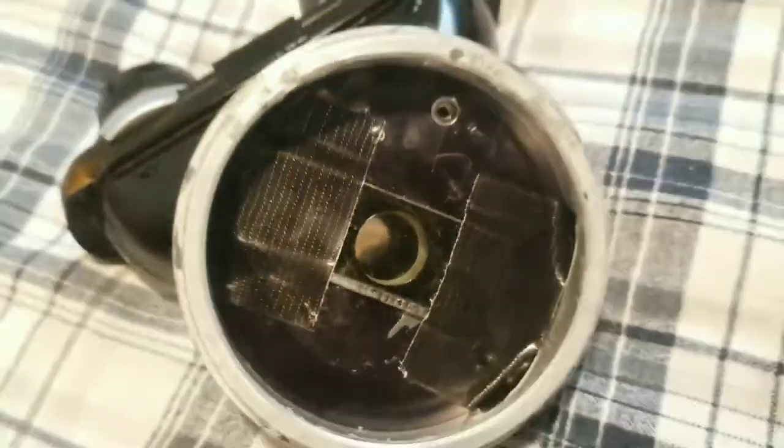As you can see, some tape. I didn't glue it because I want it to be reversible in case this sucks and it doesn't work very good. I want to be able to easily undo it. Since I've never tried a polarization filter down here before, I always put them up here in the eyepiece. You can see these nylon fibers. The background is largely black because the two polarizer filters work together to block out the majority of light.